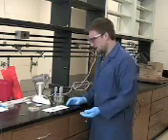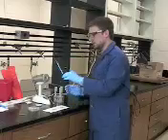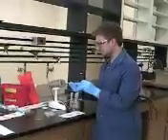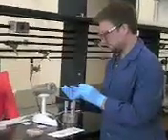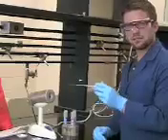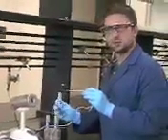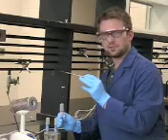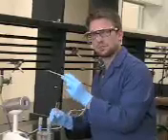Now I'm going to show you how to place your liquid cultures onto your slides. You're going to take your loop, sterilize it for 15 seconds in your Bunsen burner, allowing the loop to get hot and red. Now you're going to hold it like a pencil again in your dominant hand. And you're going to take the culture tube and hold it with your non-dominant hand. You're then going to use the pinky finger of your dominant hand, place it around the cap, and gently remove the cap from the tube.